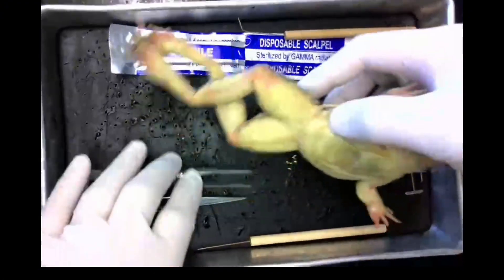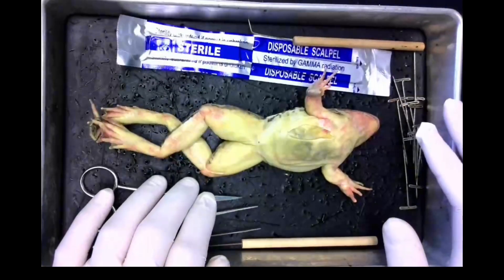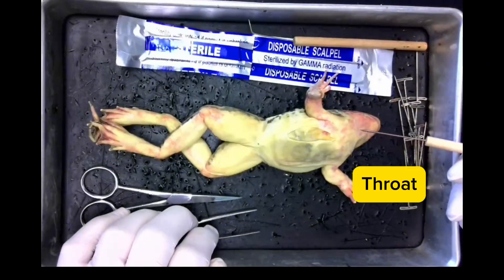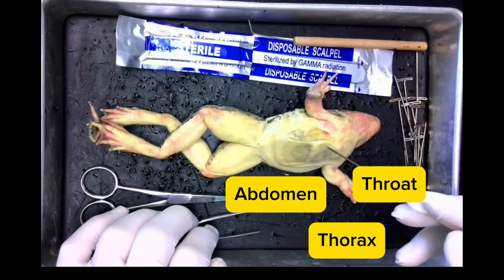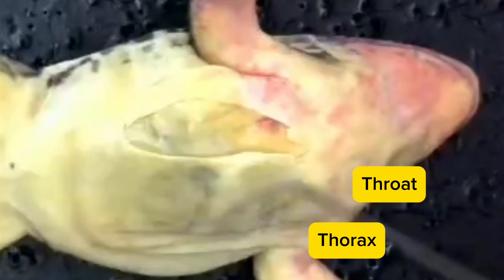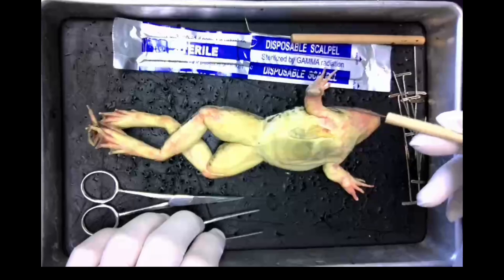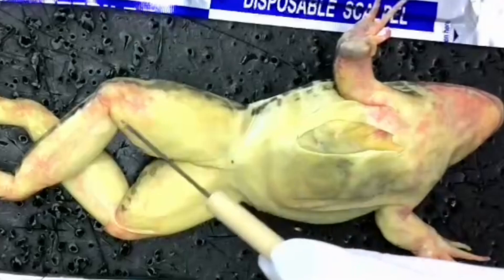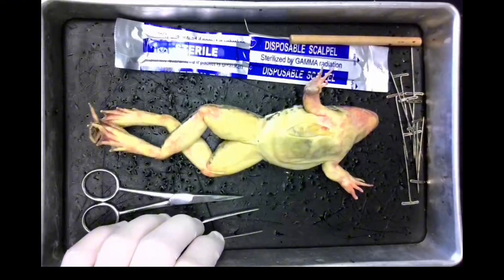When we turn the frog over, we're going to look at the belly side, which is known as the ventral side. The frog is divided into three sections: we have the throat, we have the thorax, and we have the abdomen. Notice the difference between the size of the forearms compared to the hind legs. Also, count the number of digits — fingers or toes — on the forelegs and the hind legs.